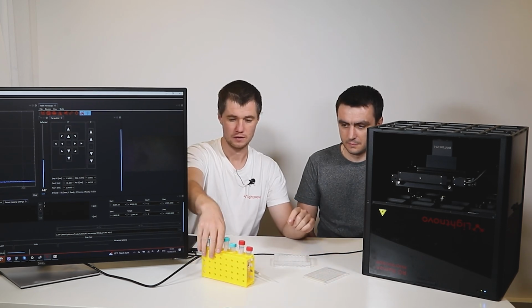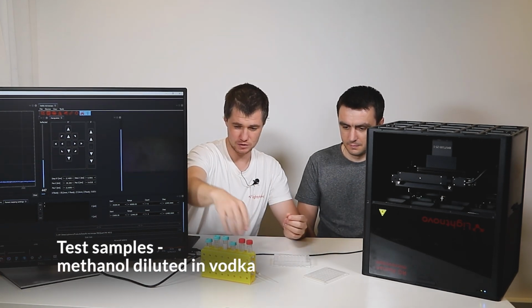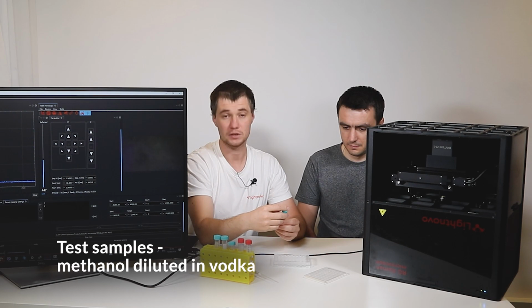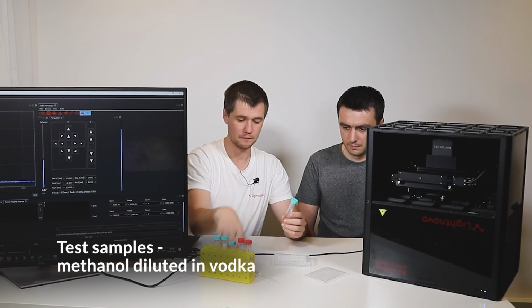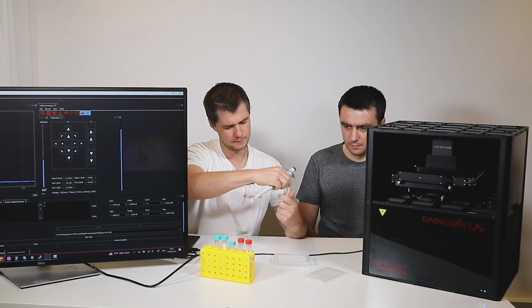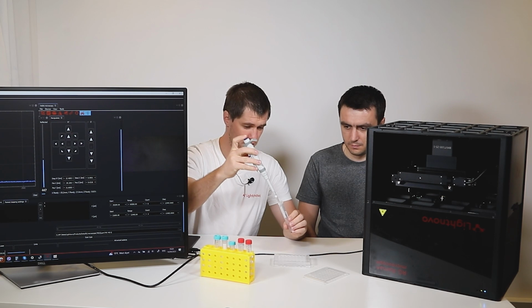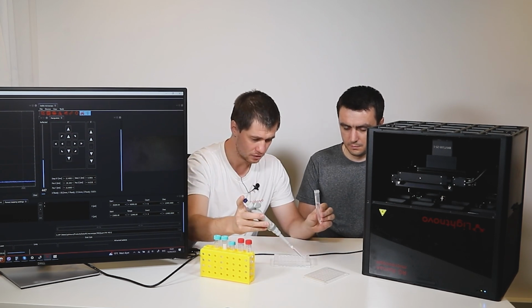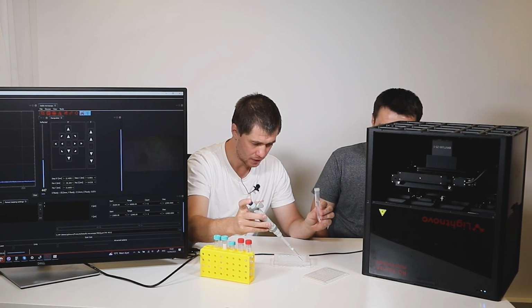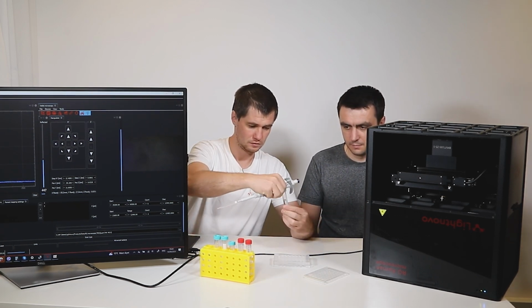we have prepared some test samples. This would be methanol diluted in vodka, and we will start with 0 concentration, clear vodka in well A1.